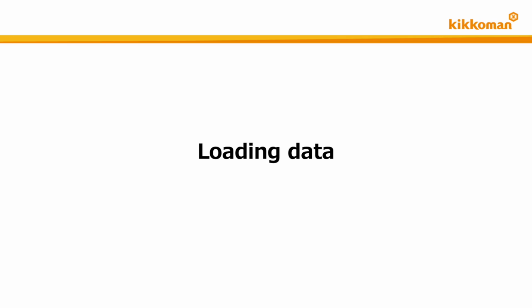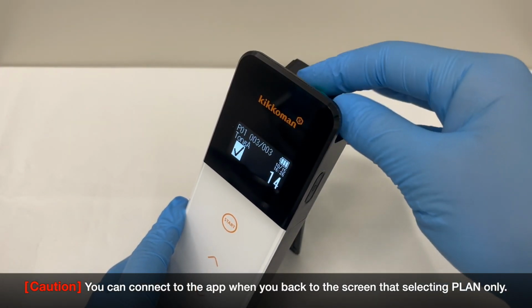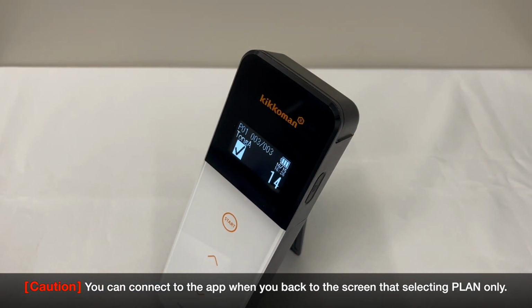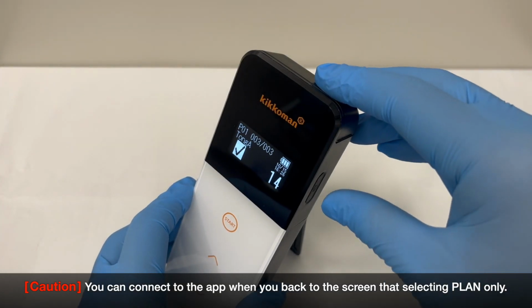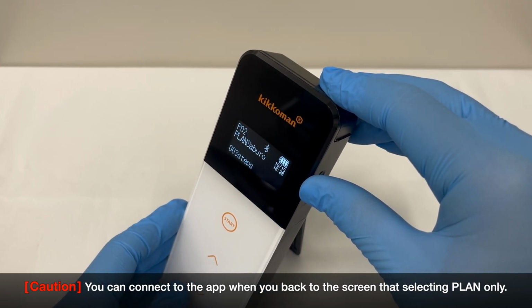At last, we will introduce how to load the test result into the app. Please note that you cannot connect to the app when you are selecting a test point, or a test result is displayed on the screen. In these cases, please press the power button to return to the plan selection screen before connecting to the app.